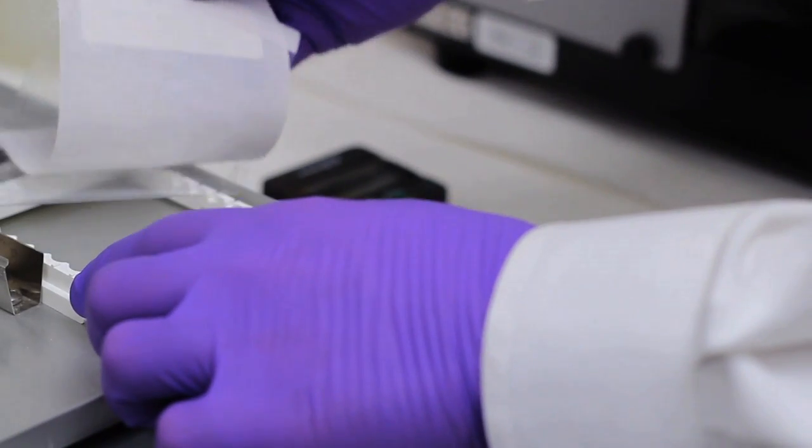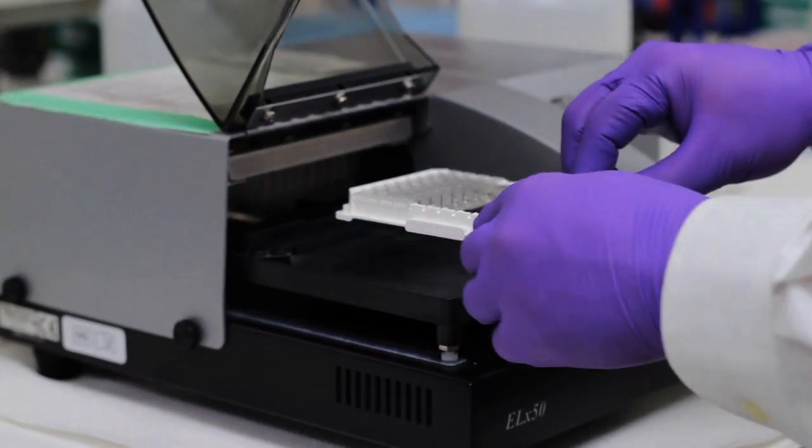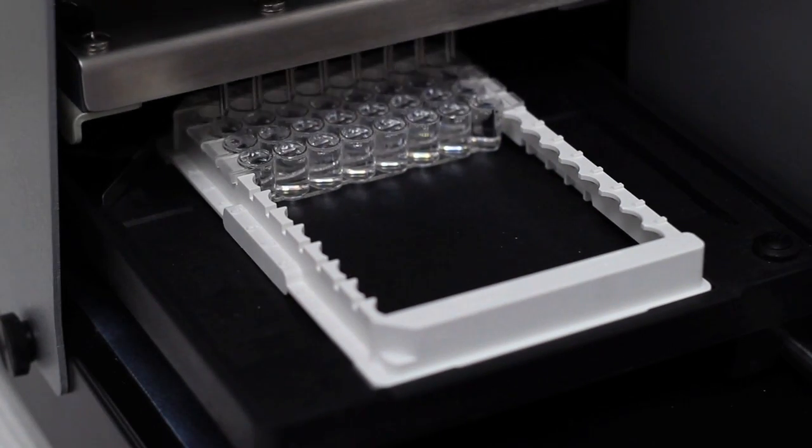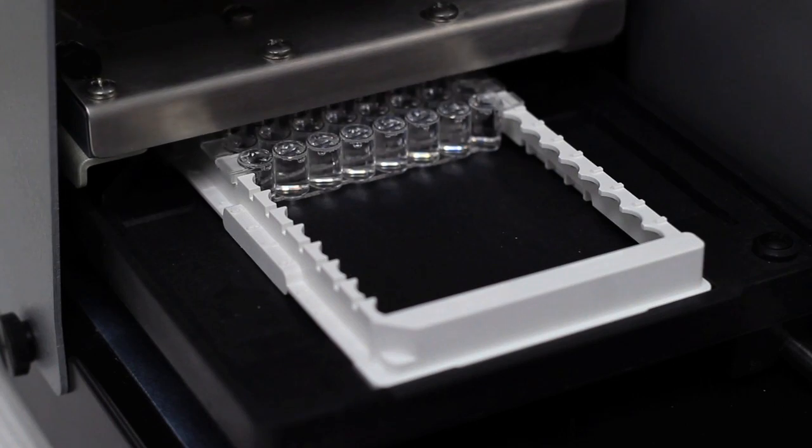Following incubation, carefully remove the plate sealer and place the plate onto the rack of an automated plate washer. Use the same method as previously mentioned and make sure the plate is dry following the wash cycle.